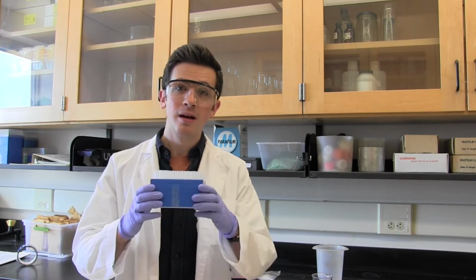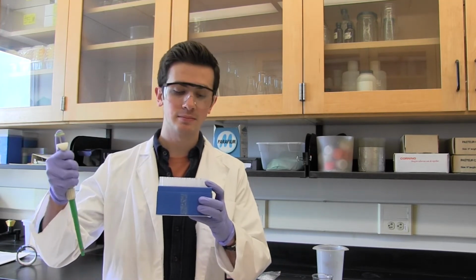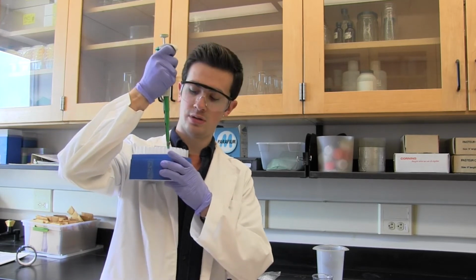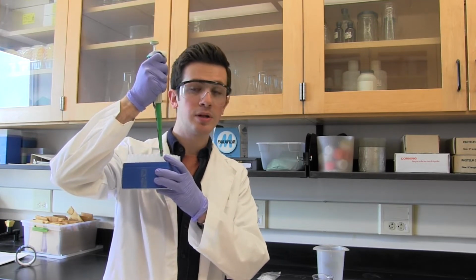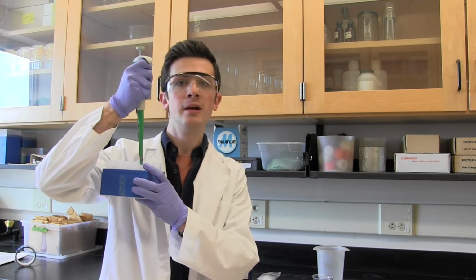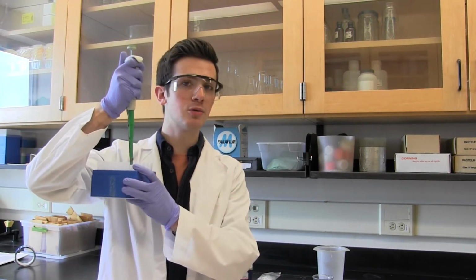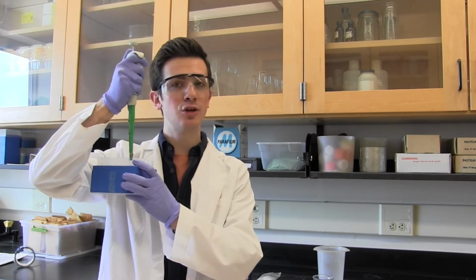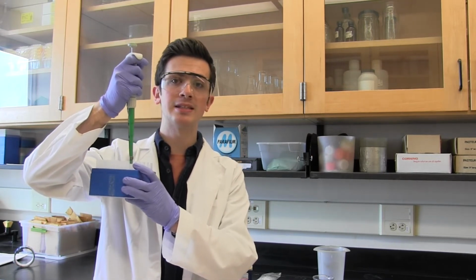It's now later. I have my rack of pipette tips and I have my pipette. I'm going to insert my pipette firmly and slowly into the pipette tip, making sure that I've depressed strongly, but not too strongly and not too suddenly. There's a lot of adverbs I'm using here, and the reason is very simple. Using the pipette incorrectly at even this simple stage can cause lasting damage to its calibration mechanism that you really don't want to get into. Believe me. Once you've inserted the pipette tip in, pull your pipette out.